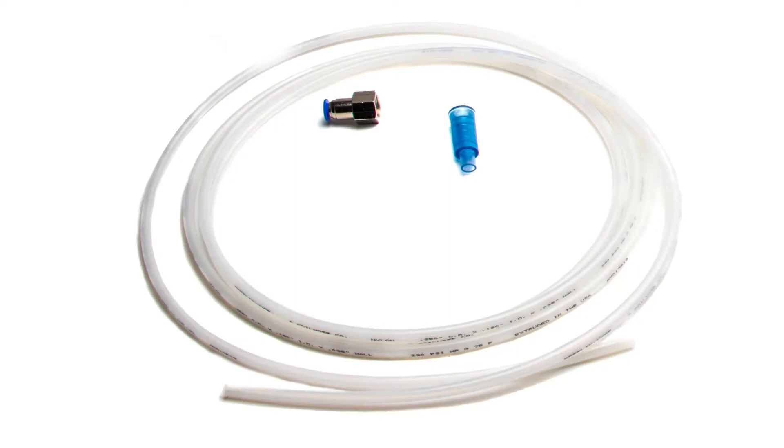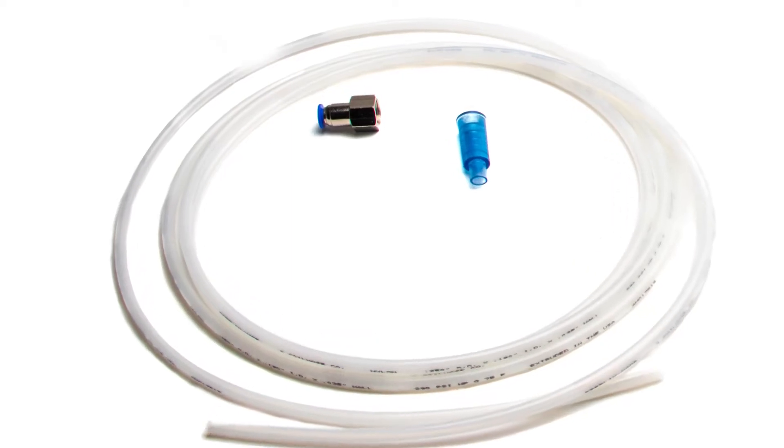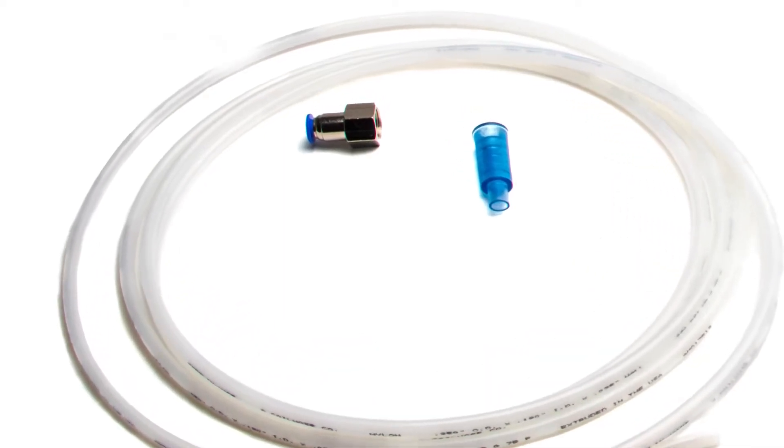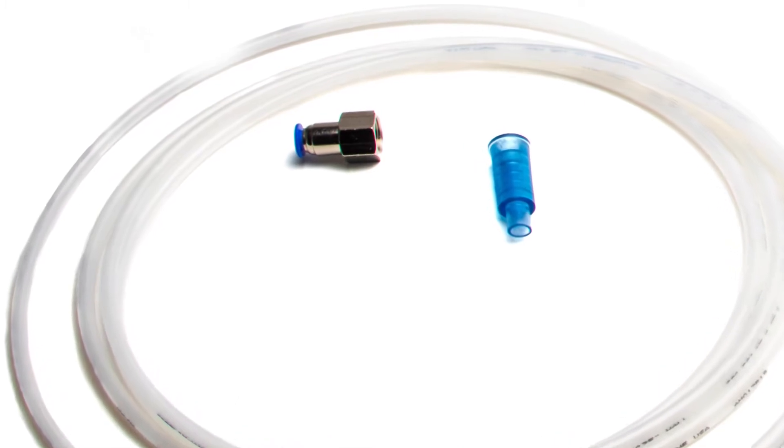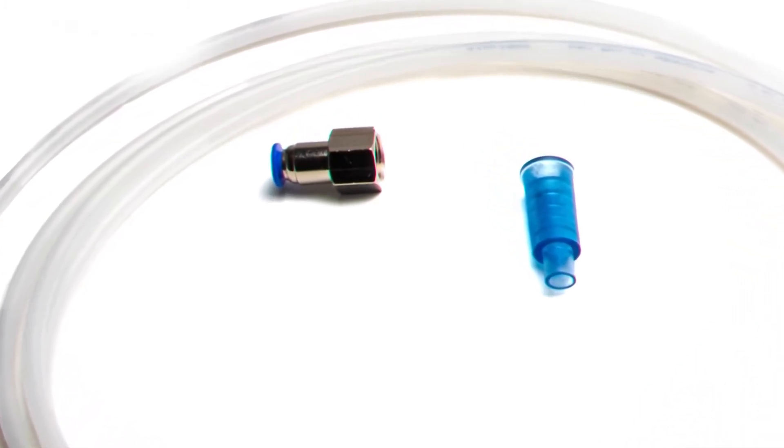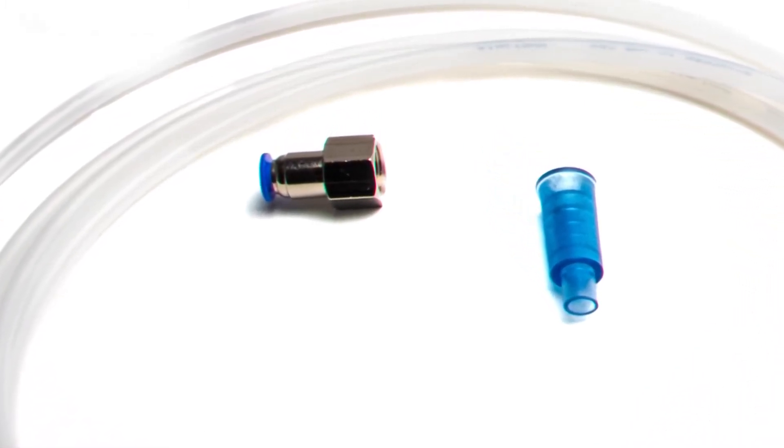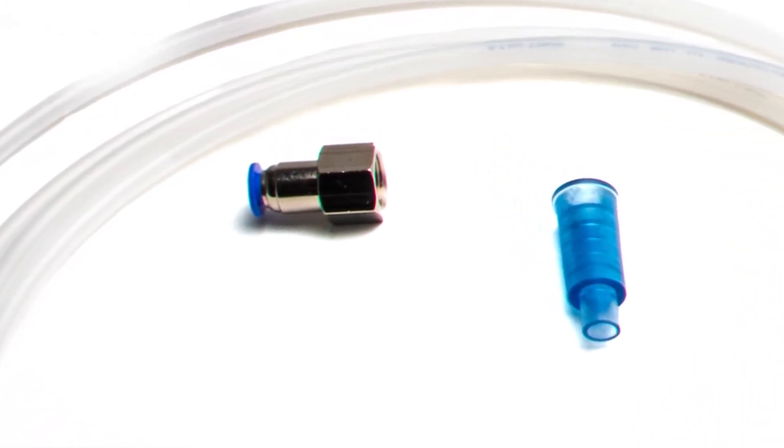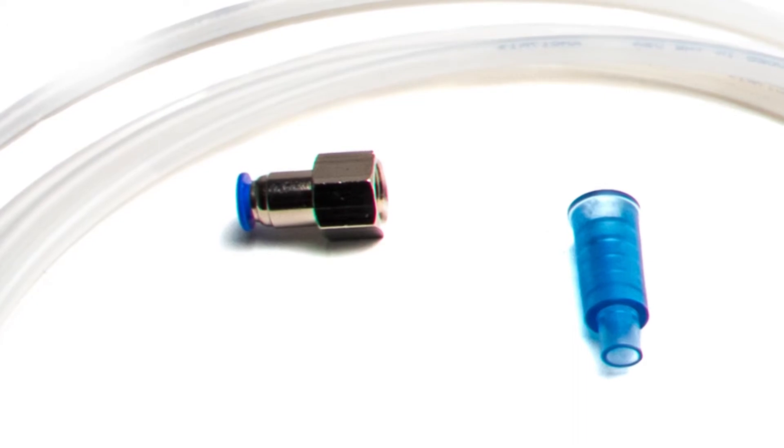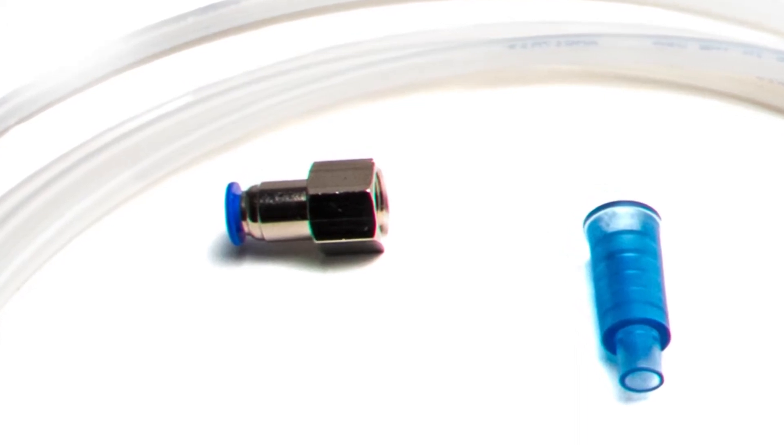The first connection is the input connection from your external pressure source. A quarter inch hard tubing that is included can be cut to fit. It is used for connecting your pressure source, a tank or a pressure pump.